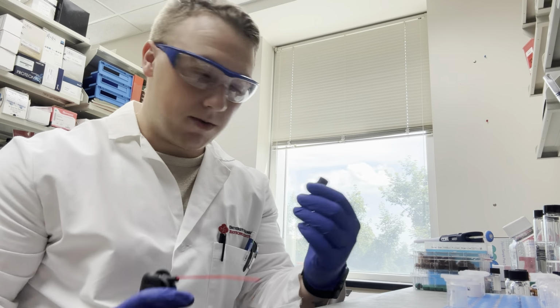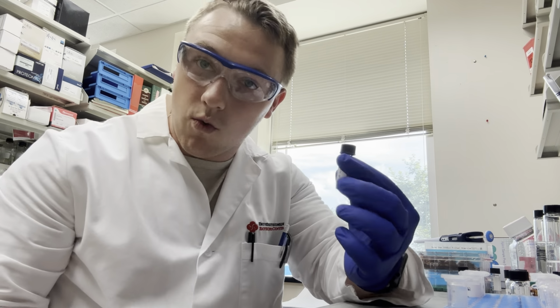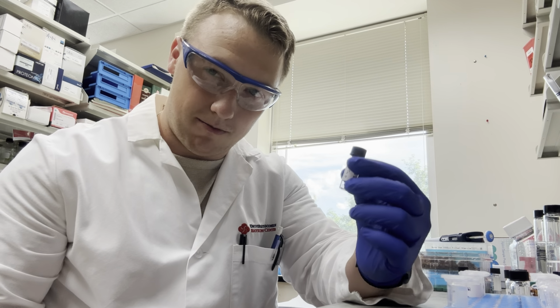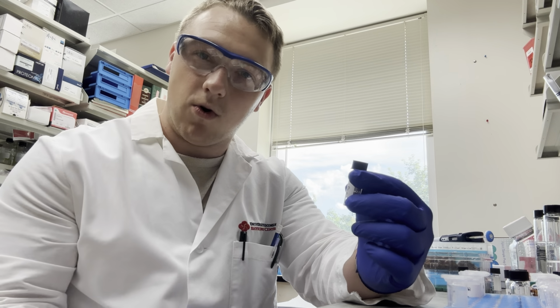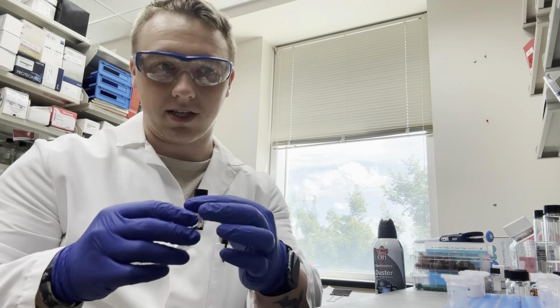You want to do this before you measure it, obviously, because all the stuff that's caught in the bottle or on top of the rim is going to be added to your weight. So you want to do that before, not after, to make sure you have a nice clean measurement for your samples. If it's a little dirty, just use a little air, but be wary of not blowing all your sample out of it either. Okay, so just something that I forgot to mention.